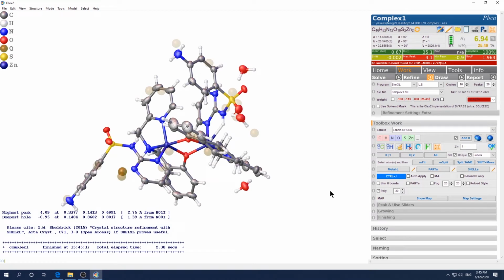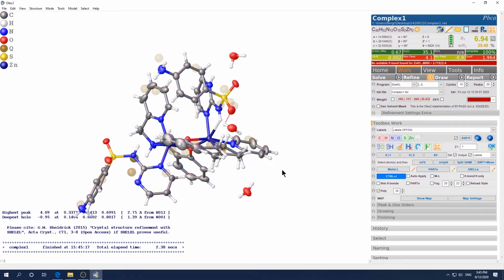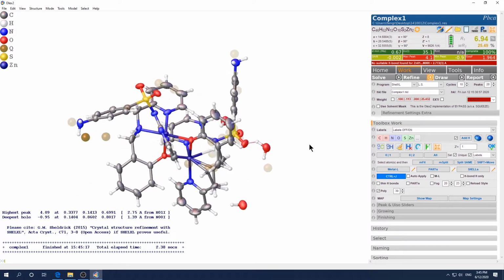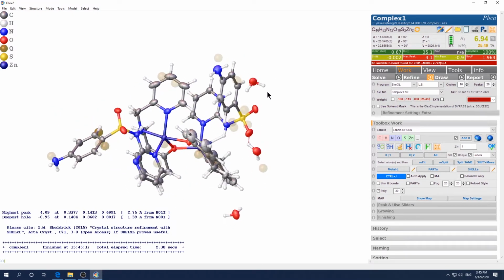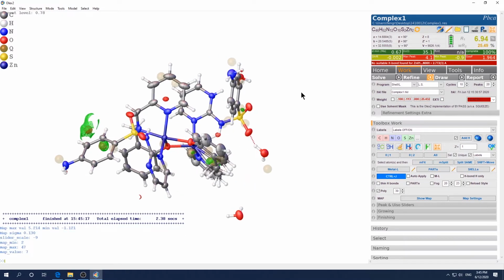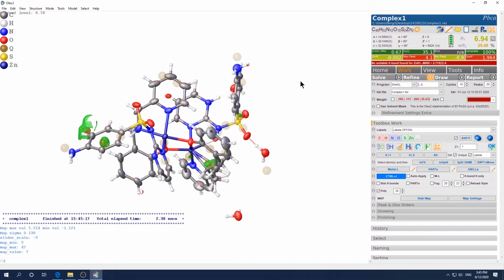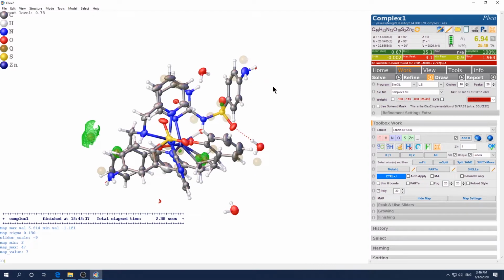And let's bring up the, I already see one problem here, a potential problem there. See, this proton is here and they have a Q peak in that position. Let's bring up the map again. Okay, and you can see that there are negative, so electron hole here and Q peak there. That means this proton should be here.